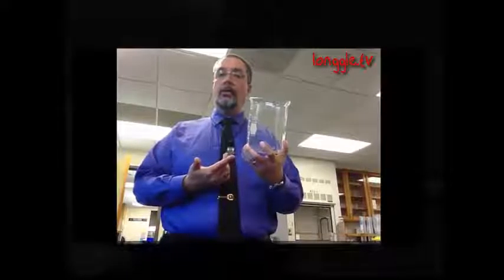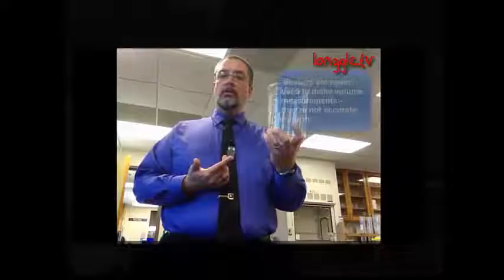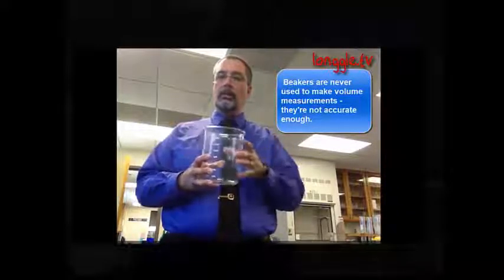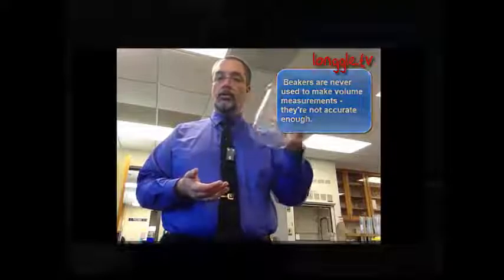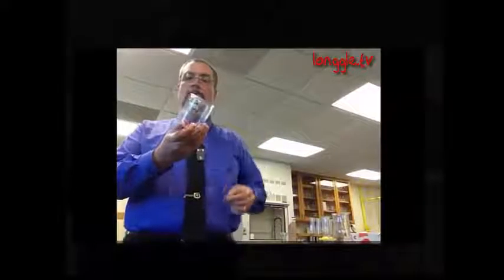They're not very accurate. You don't really measure with beakers. Beakers aren't used to make measurements. Beakers are used just to hold stuff. So you might put a liquid in here. If you wanted to boil some water, for example, quite a bit of water, you would put it in here. Beakers come in various sizes. This is probably one of the most common sizes.